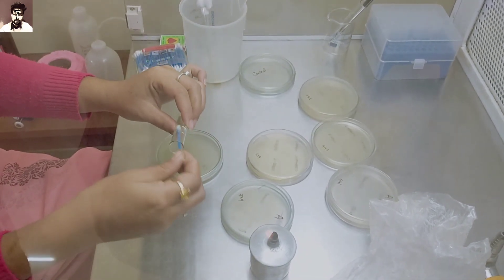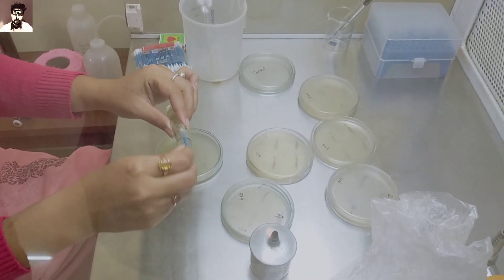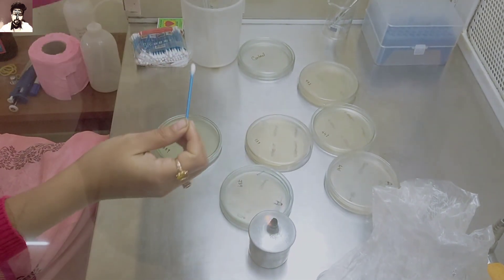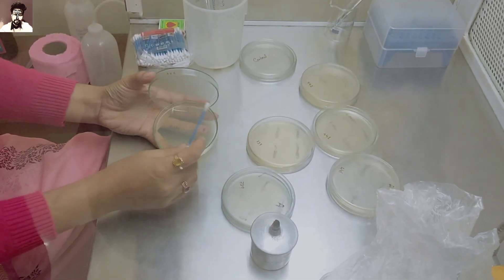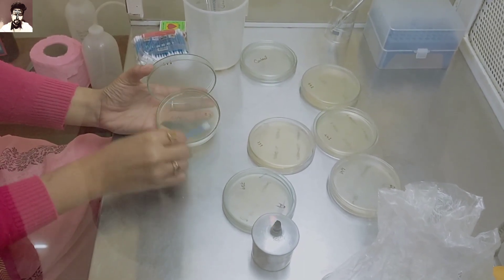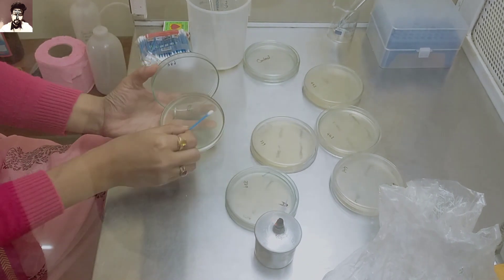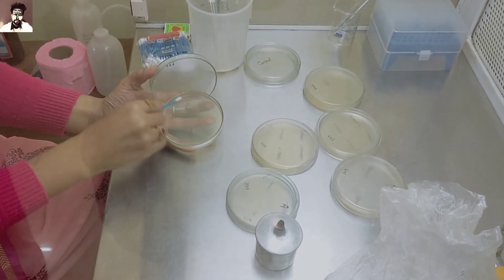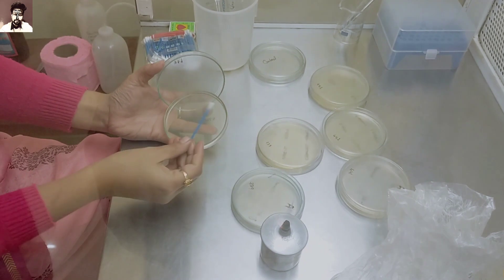In the next step, the nutrient agar solution is equally distributed onto the glass plate. After the nutrient agar solution is dried on the plate, we write an indication of the plate and the bacteria. Then we distribute and equivalently swipe the bacteria across the plate.